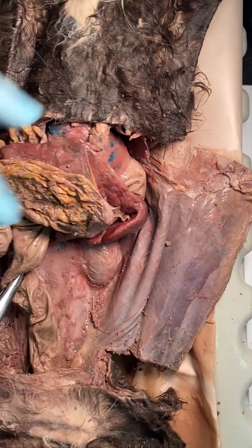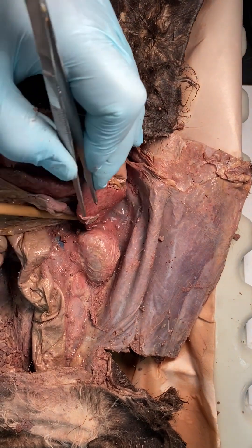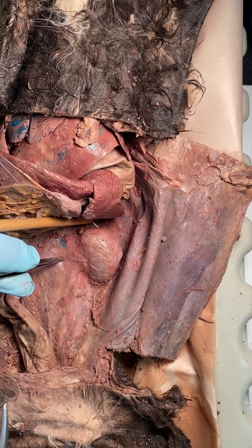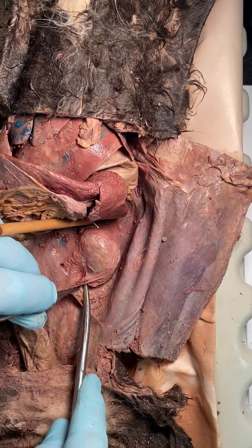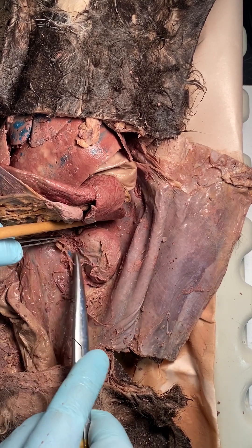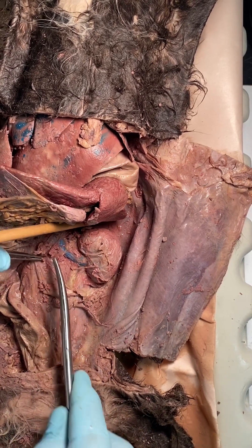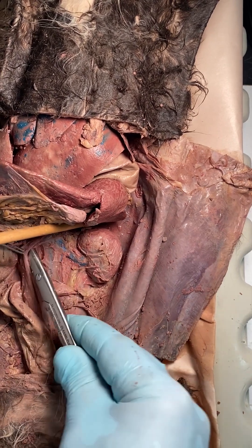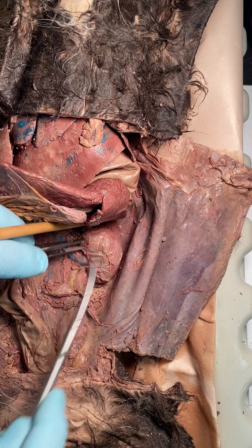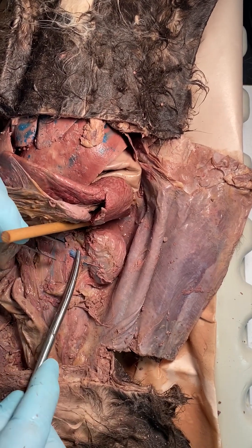Finding the kidneys is useful because you can find the renal artery very easily. I'm cleaning this up now. Take a probe and stick it in there — if you have another student, put them to work holding things out of the way. As you uncover the kidney and remove the peritoneum, there's the renal vein going to the kidney, and right next to it is the renal artery.